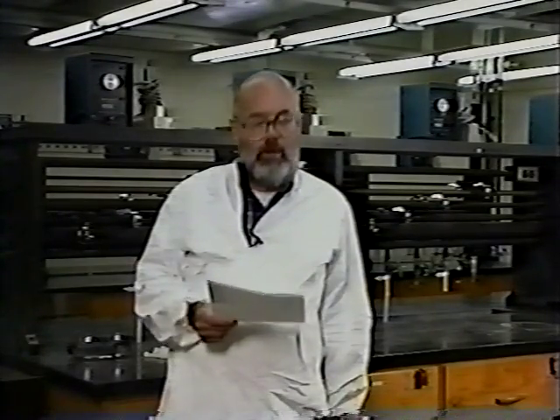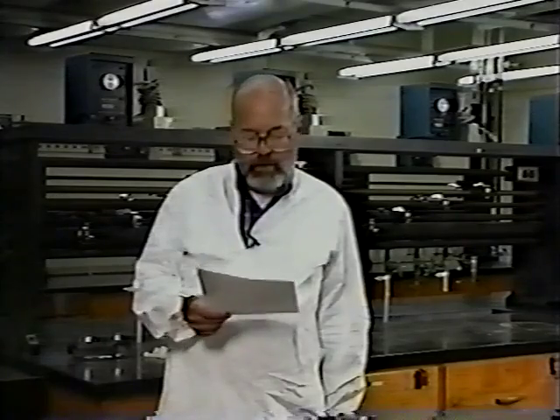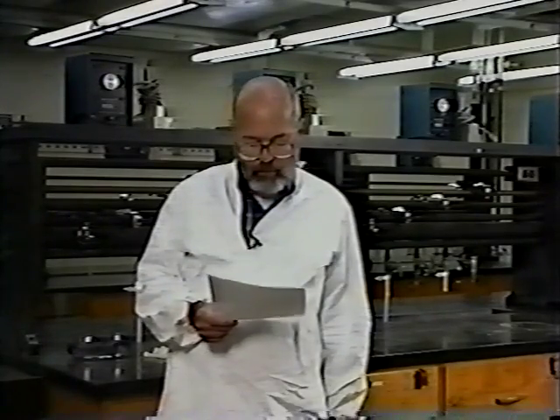Now, let's take a look at some of the equipment which is available for use in emergencies in the laboratory, and also some equipment which we will be using on a daily basis in performing the experiments in our laboratory course.